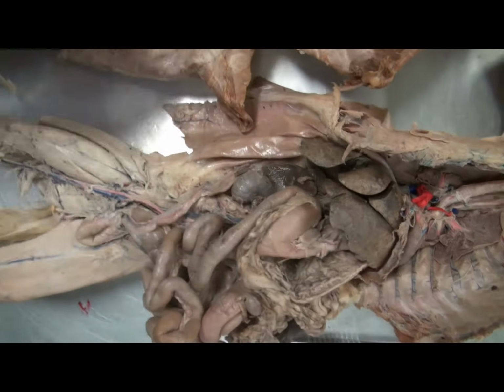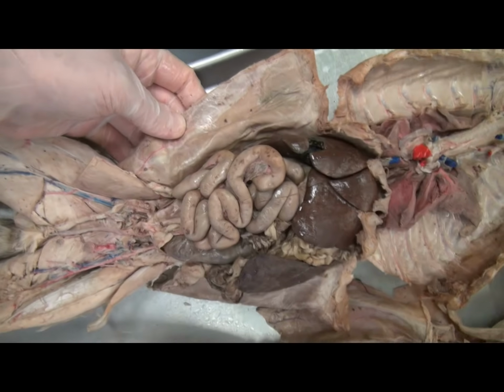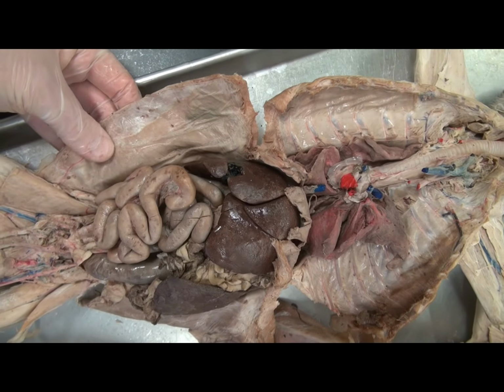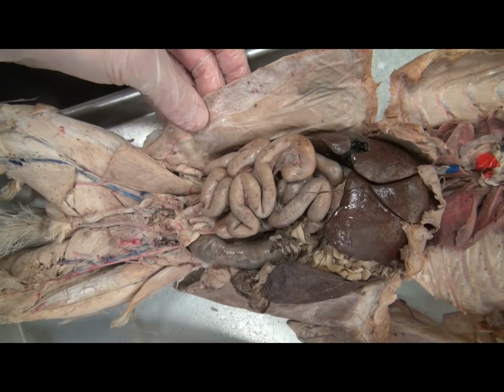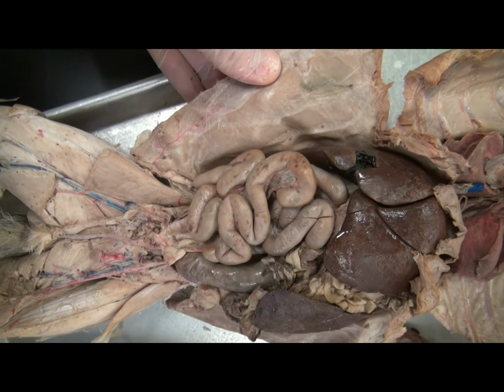All right. Now, in the abdominal pelvic cavity, one notices that these digestive structures are covered by serous membranes, just as the heart and lungs were covered by the pericardium and pleura, respectively. The serous membrane which covers these organs is known as the peritoneum. There is a parietal peritoneum.